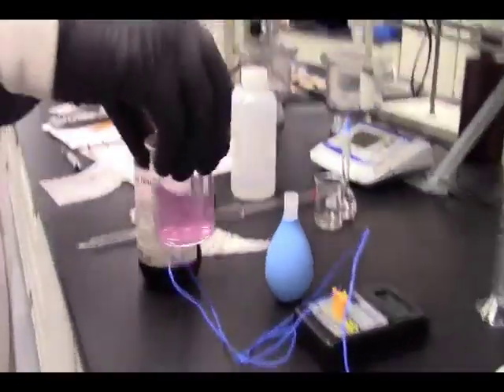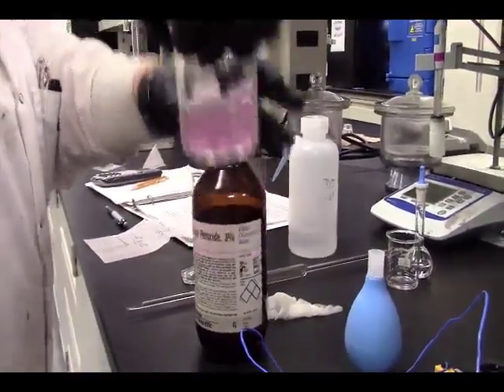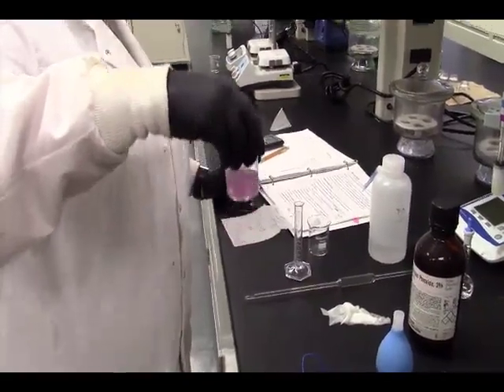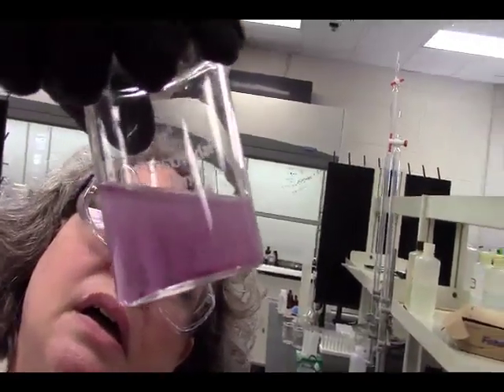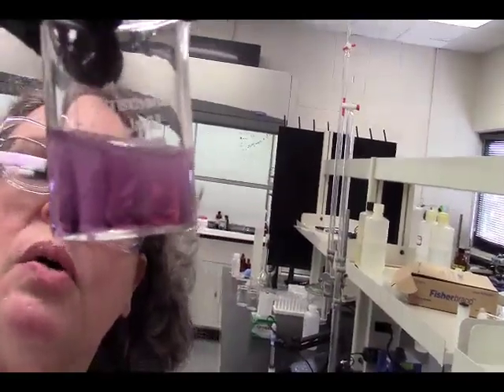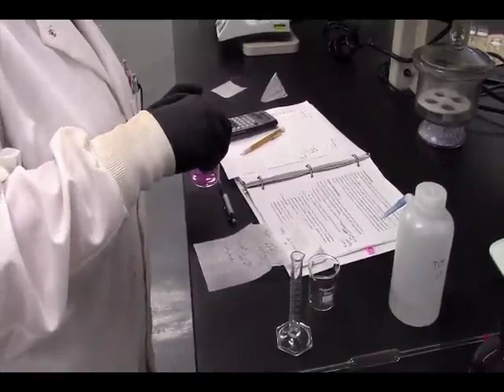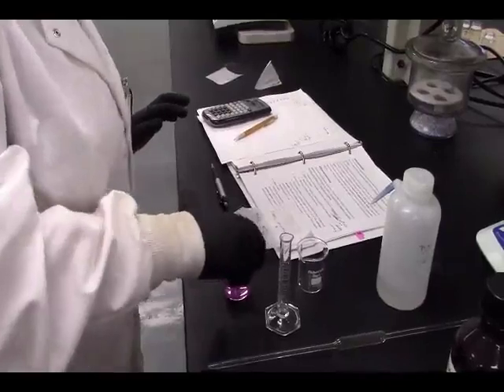And we got a color change, so something happened. Okay. This says to stir until bubbles stop and color stays consistent. Those are bubbles in there, not solid. So we need to wait till the bubbling stops and the color stays consistent. While this is going, we can move on to make our next complex, which is our oxalate complex.